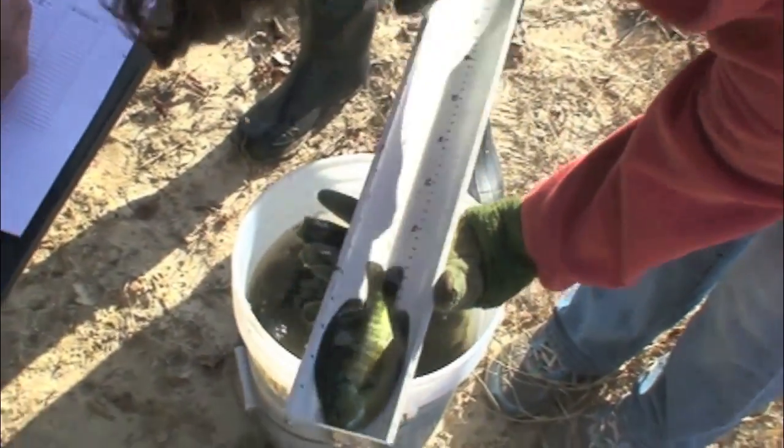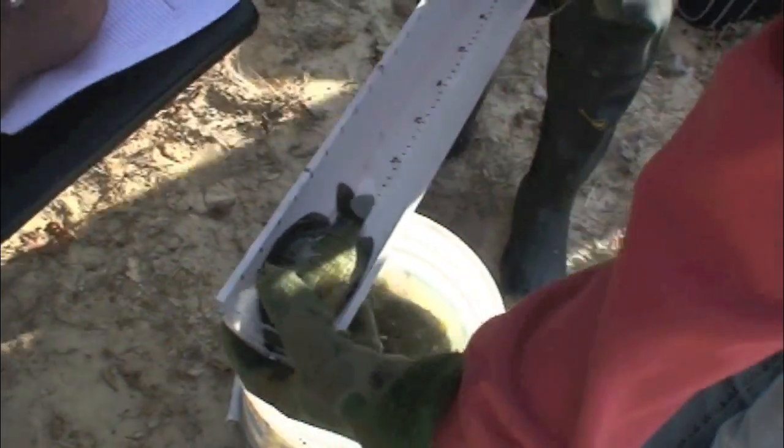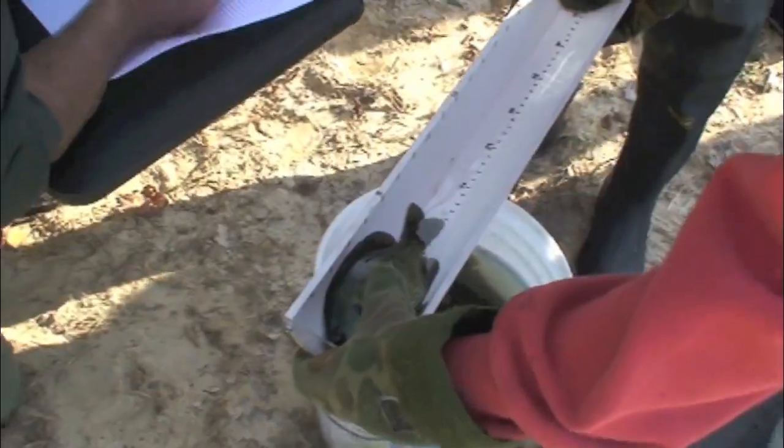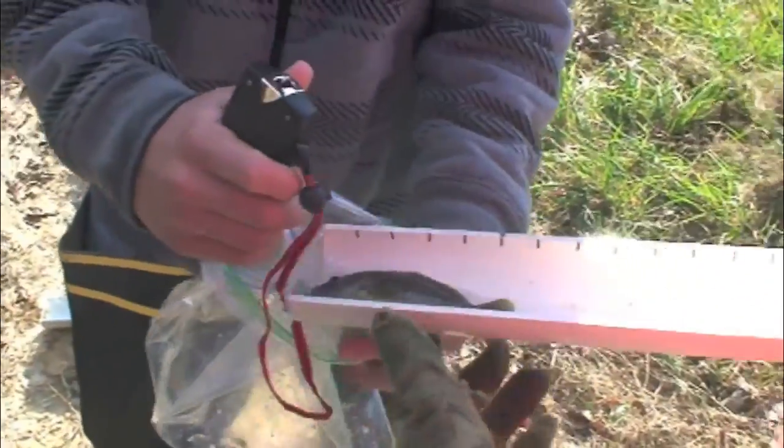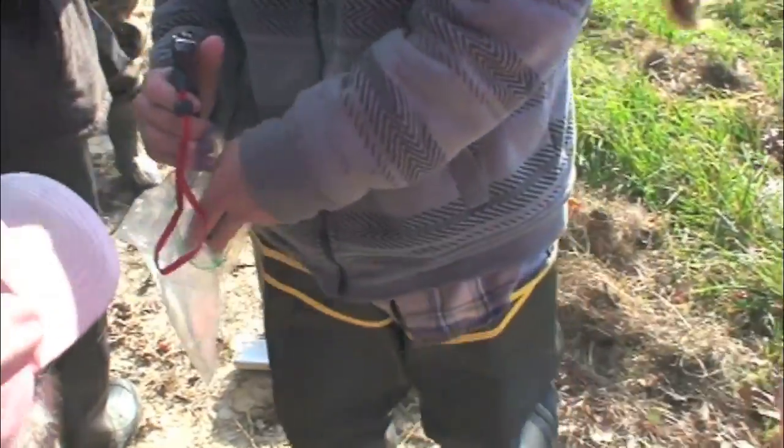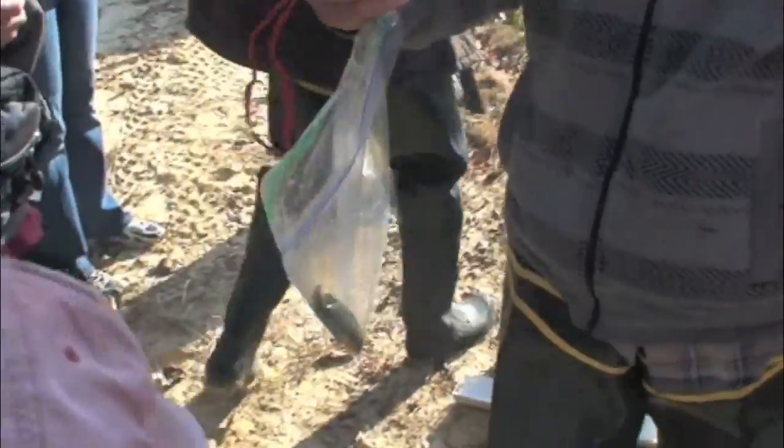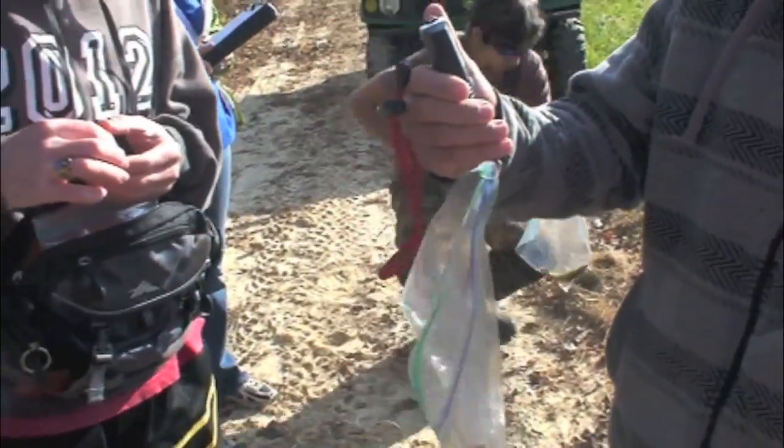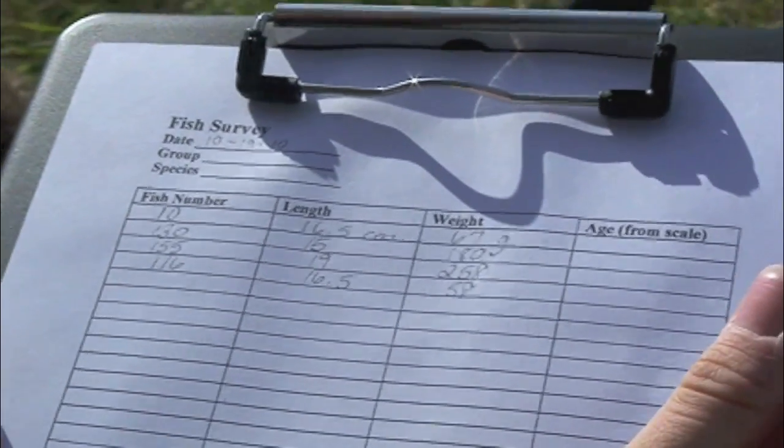Once you have caught some fish, measure and weigh them. Be sure to record this data as it can be used to determine if the fish are the right size for their age.